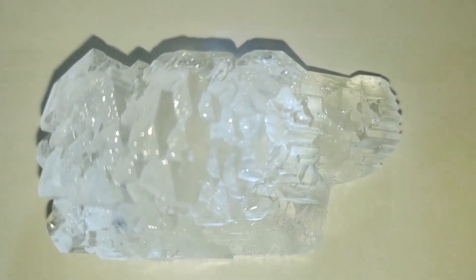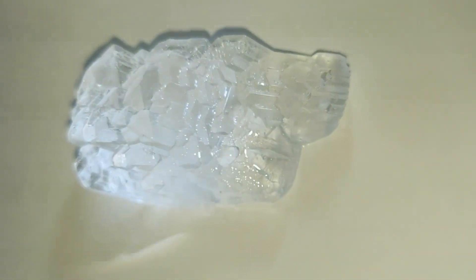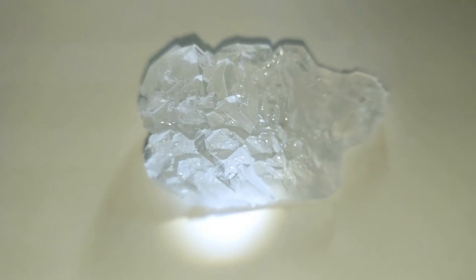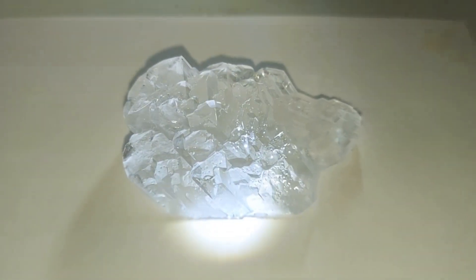But it's definitely sulfuric acid in solid form. I'm gonna save this. I think I'm gonna put it in my freezer. Yeah, it's just fascinating.